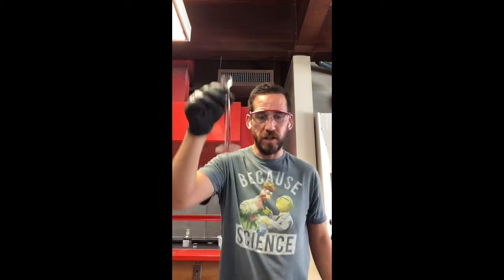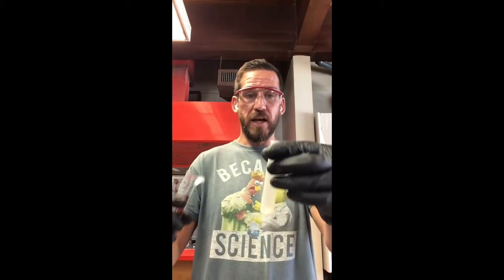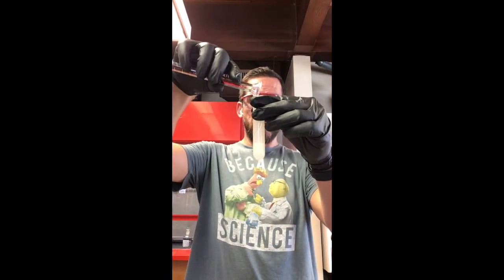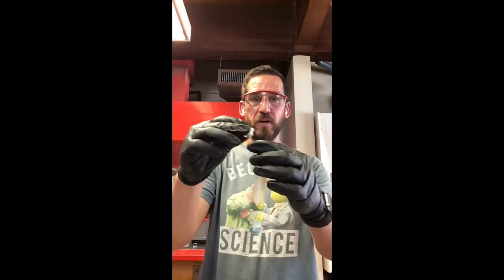Now, remember when you're reading where the level of the water is in any kind of vessel, you want to kind of get at eye level and check out the meniscus, right? So you'll just have to take my word for it when I do this. Boom. It's good. So let's go ahead and pour that inside of the centrifuge tube. All right, so we're going to go ahead and cap this.